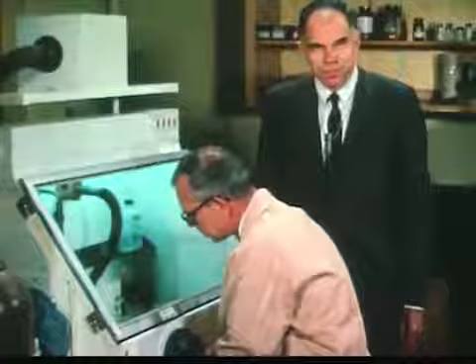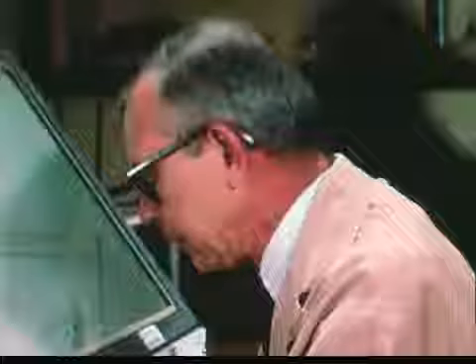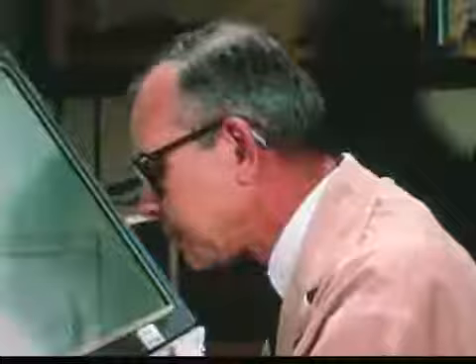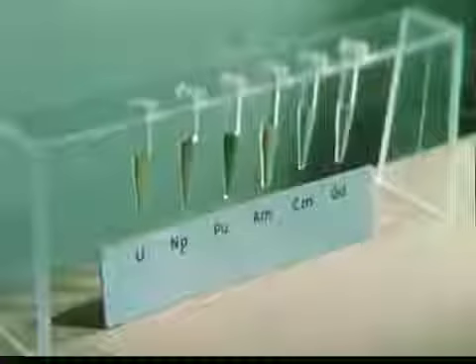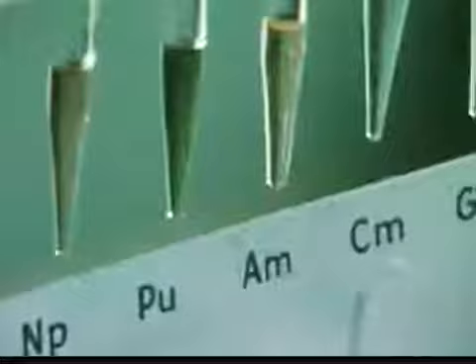In order to investigate the chemical properties of these elements, we go to the laboratory of Dr. Burris Cunningham. Dr. Cunningham performed the earliest ultramicrochemical experiments on plutonium and many other transuranium elements. He was the first man in the world to actually see plutonium. We are ready to perform some experiments with the transuranium elements — these experiments will tell us something about the oxidation behavior of these elements. Here are ionic solutions of the nitrates of uranium, neptunium, plutonium, americium, and curium.